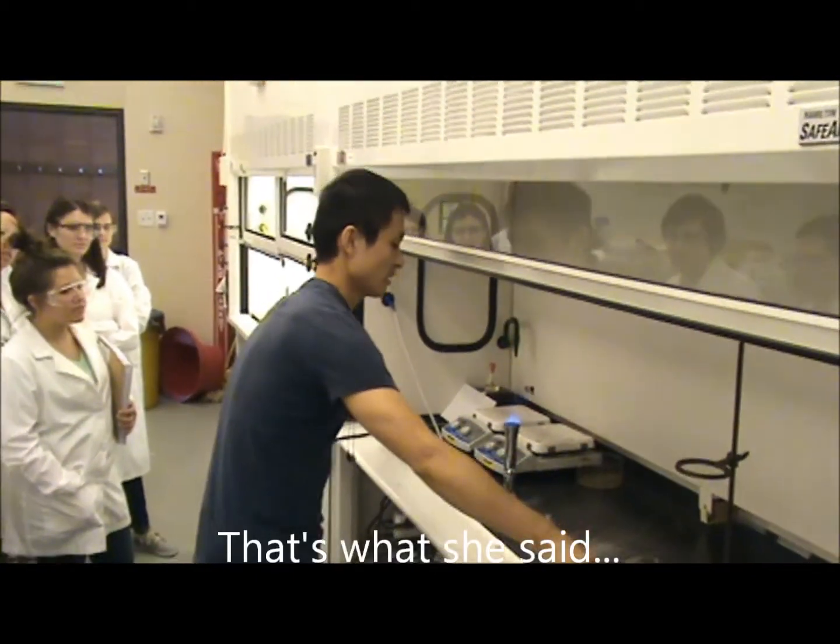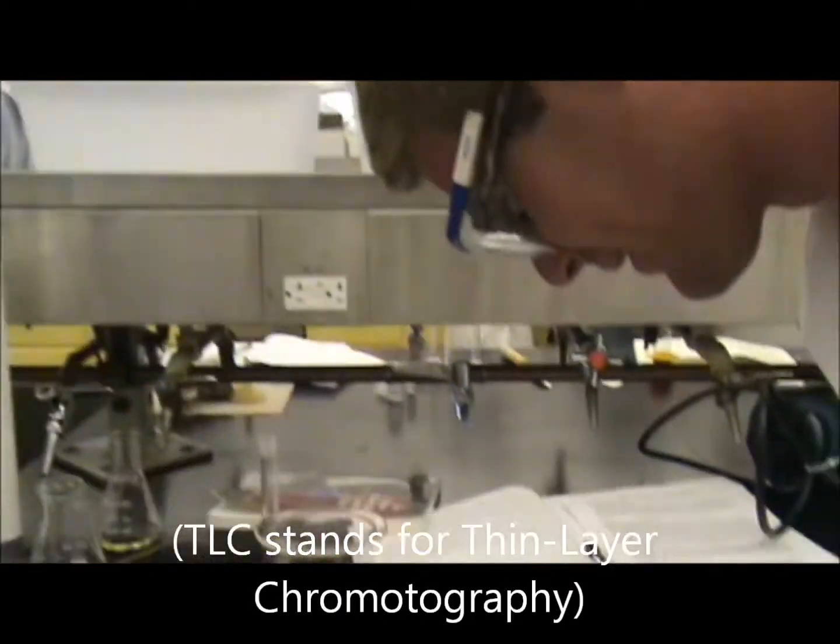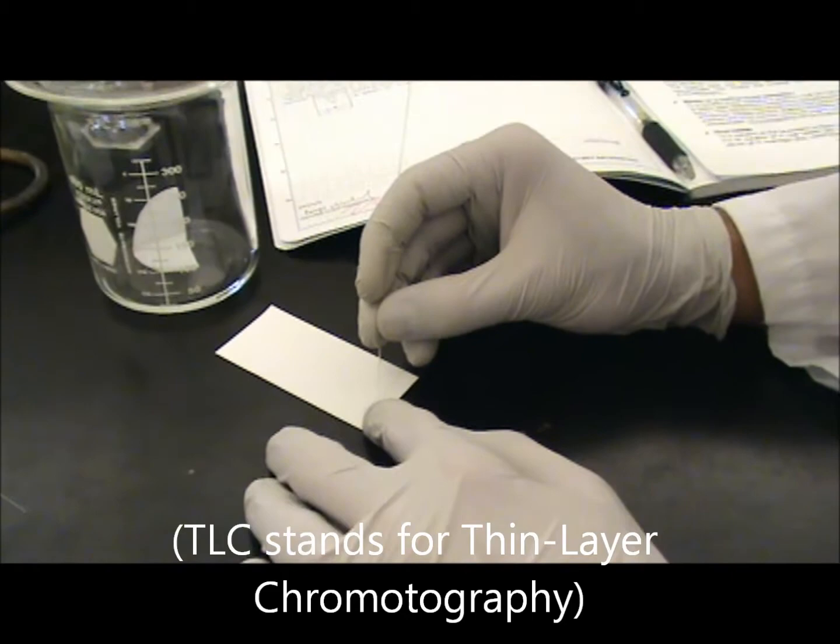Actually, it can be longer. I'm having a TLC plate right now. Woohoo! TLC! Amazing!